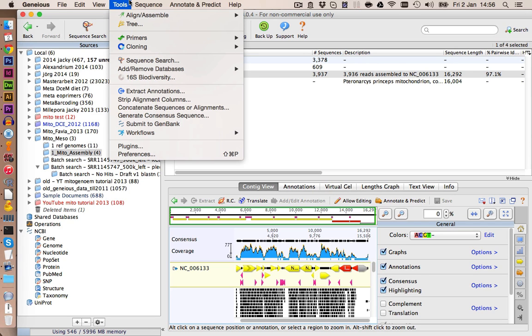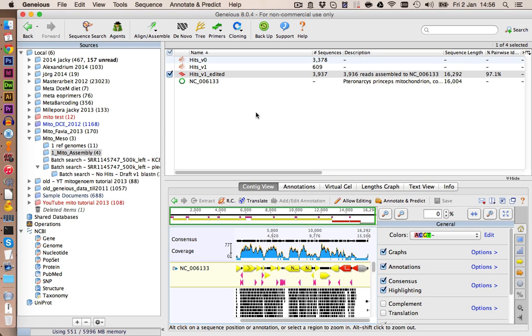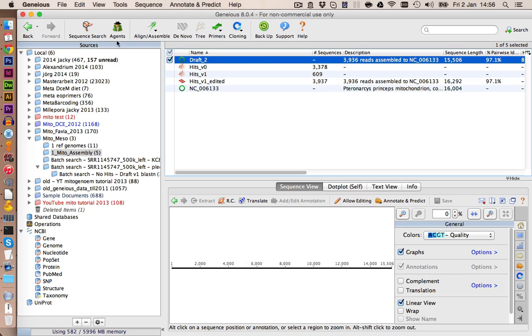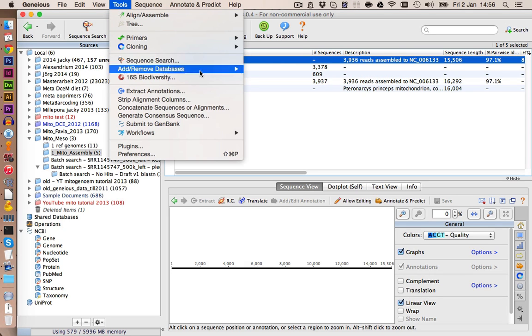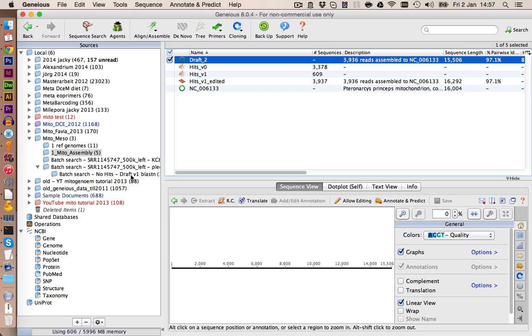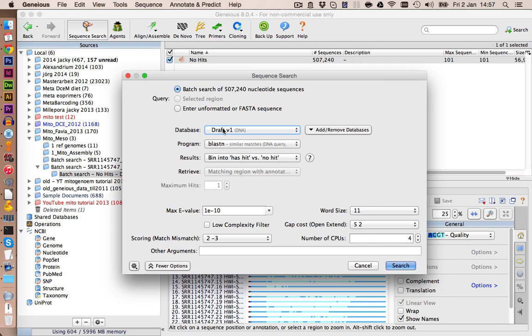Let's again make the consensus sequence. You can do this under Tools, Generate Consensus Sequence. Let's click on OK. And we call this one Draft 2. Again, we're going to add this to the database. And we're going to go to our no hits and run a new BLAST search against Draft version 2.